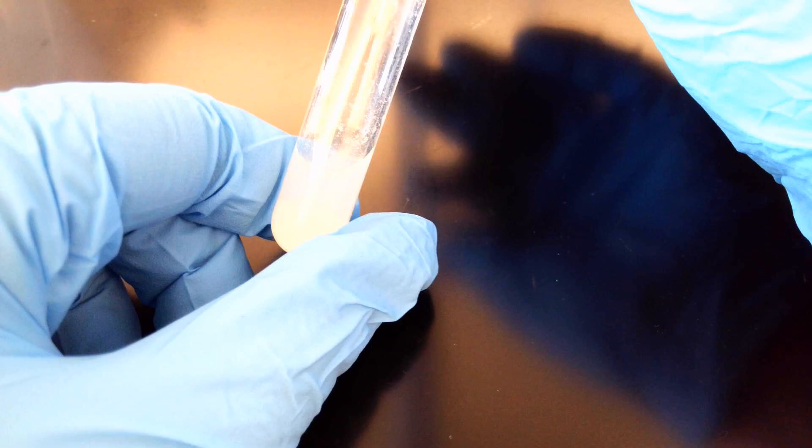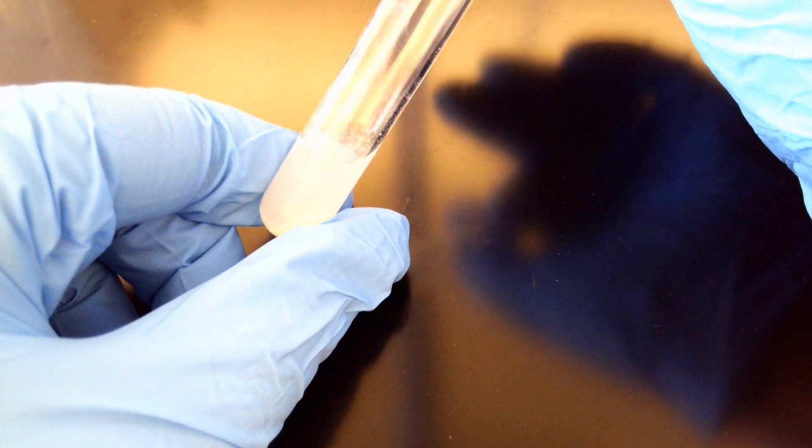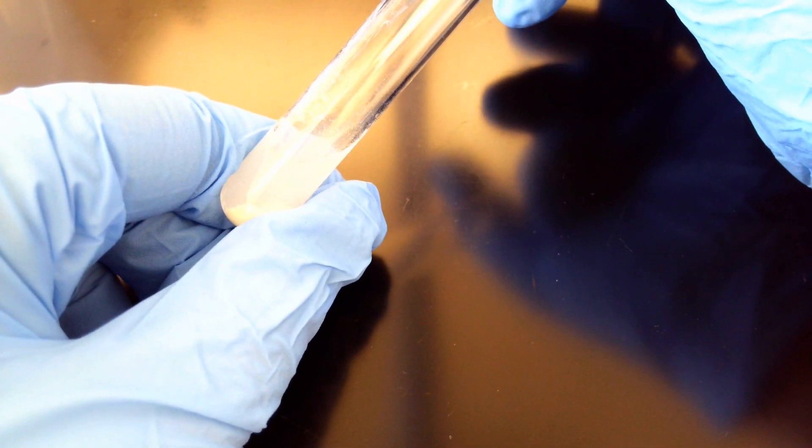Let me try to lower it a little bit to get you closer. Got the light, I'm sorry. There's our first one, solid precipitate hanging out at the bottom.